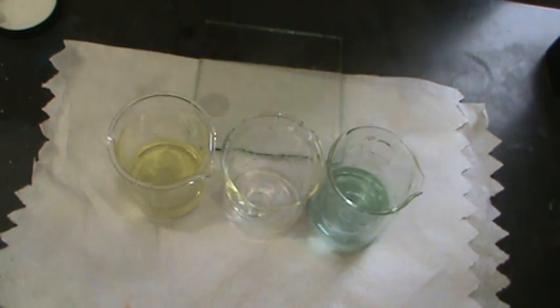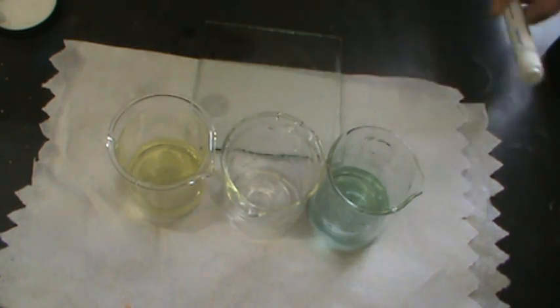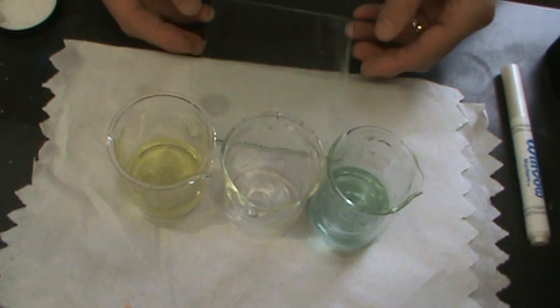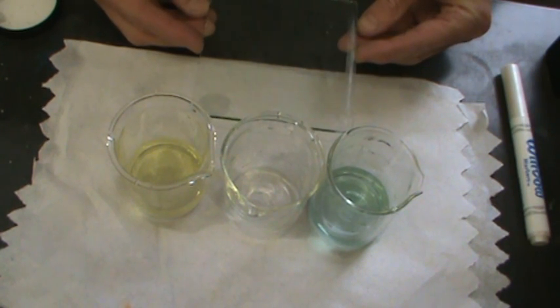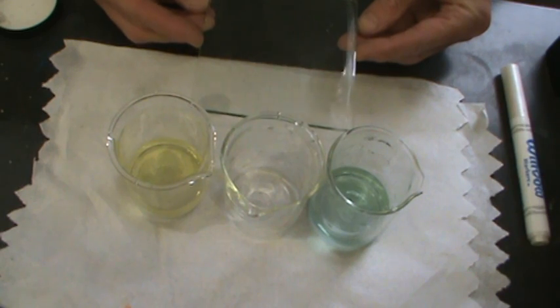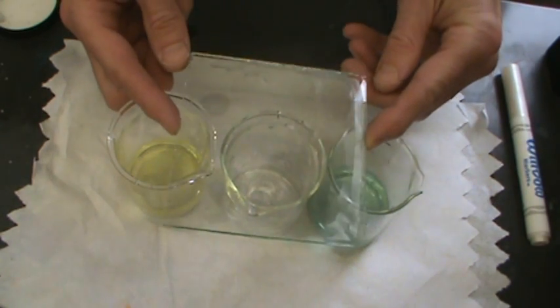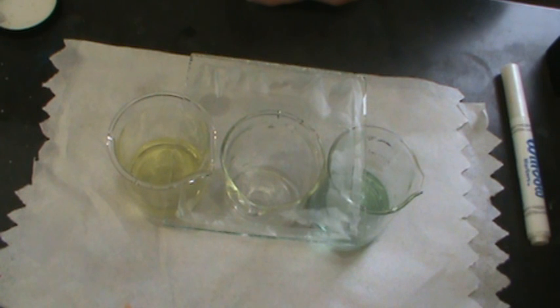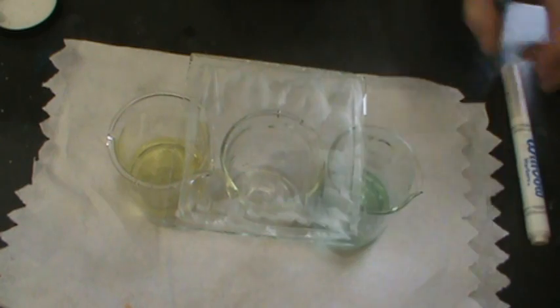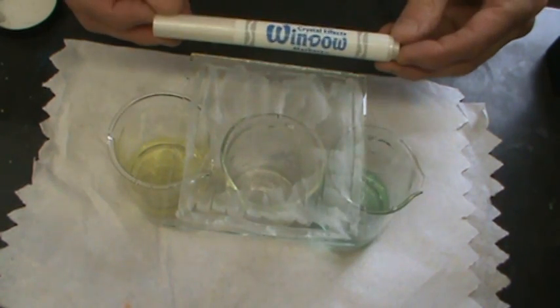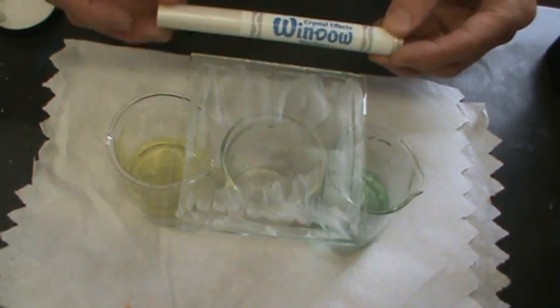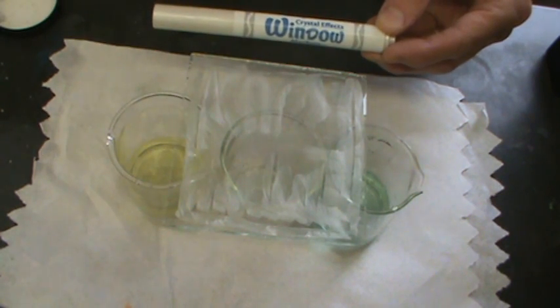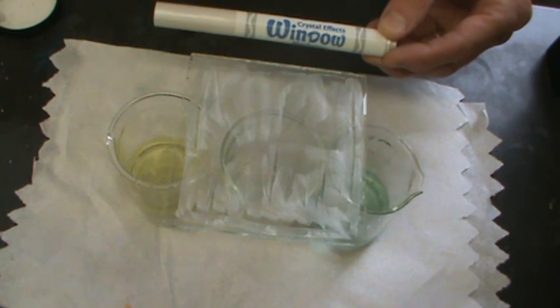Okay. There we can see it's starting to go. It's taking a little while. There it goes. There's crystals growing in. I'll put it right there. Let's watch those crystals grow in. It's beautiful. Again, we think that these markers contain a super-saturated solution of sodium acetate. So I think this is just sodium acetate crystallizing out on the glass pane.